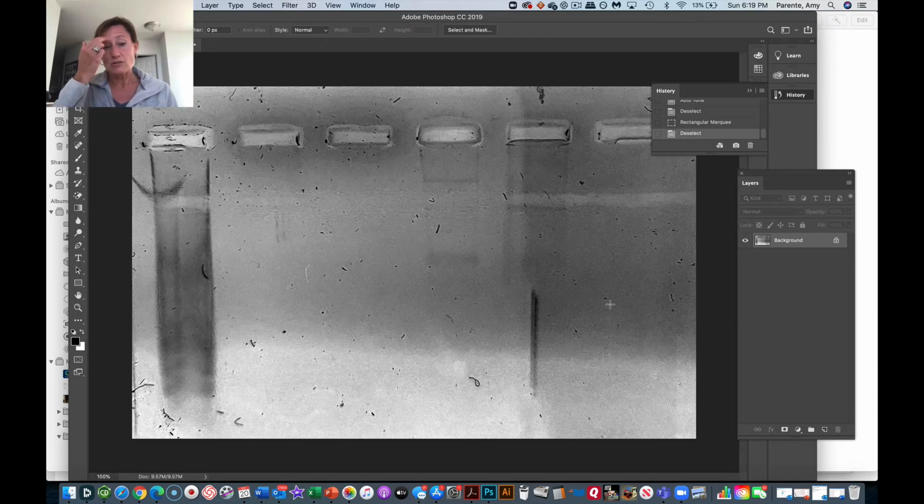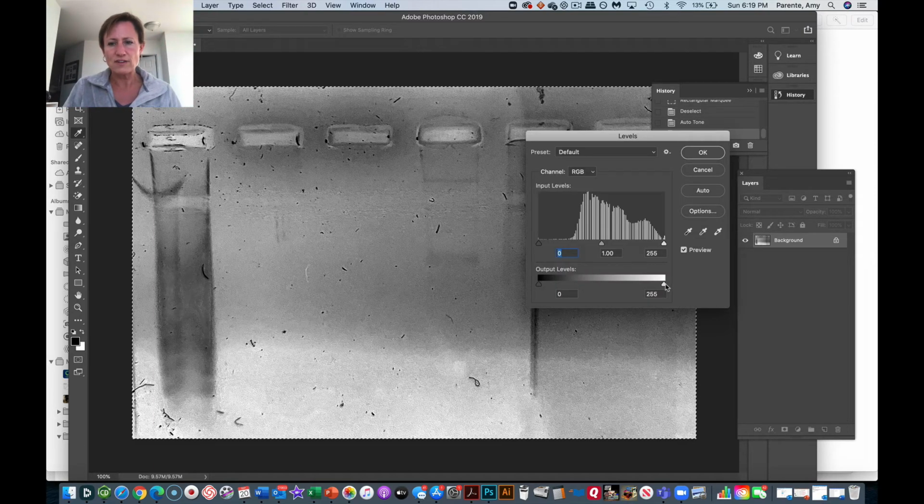What we can do is continually change the entire image. So if I select all of this and now I fix levels, I can adjust the intensity to try to get the overall image of what I'd like to see. But anytime you're manipulating the intensity of bands or things like that, you want to do it exclusively to the whole gel. Now, another option you could do, this is acceptable, is if you wanted to take a little portion of it, make a new figure of it, and then change the intensity and show that this is an inset for this gel, and I've taken this part and specifically manipulated this part, but that has to be clear to the reader.